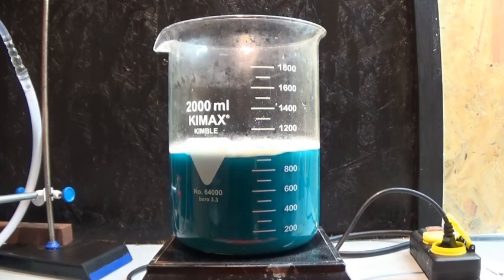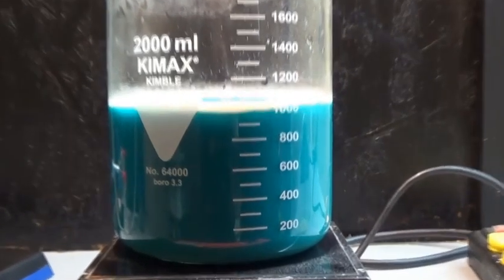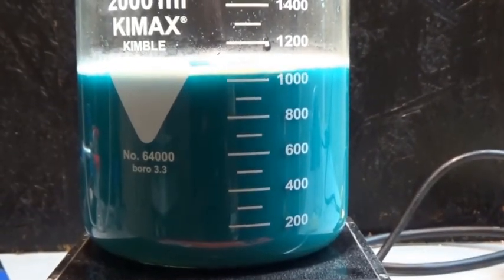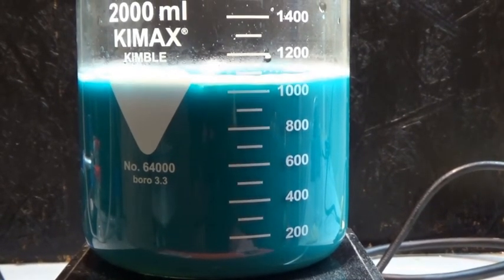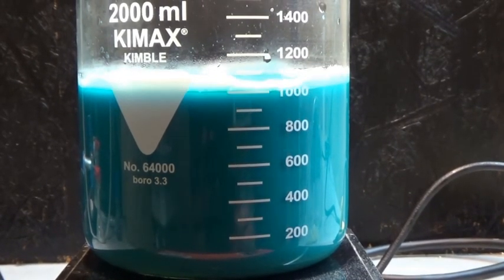After some time you can see a cloudiness appearing. This is calcium sulfate immediately crashing out of solution when formed. This is then slowly sinking to the bottom of the beaker and creating some nice phase transfer images.